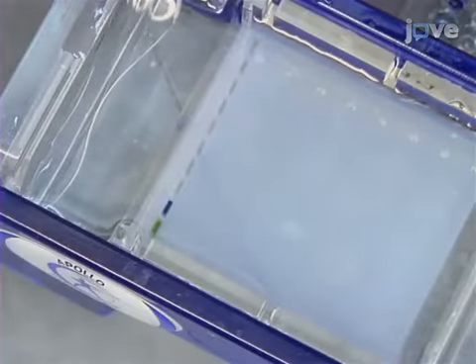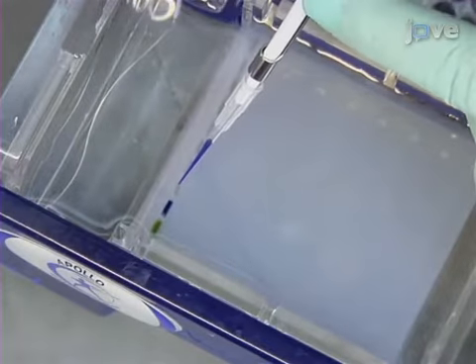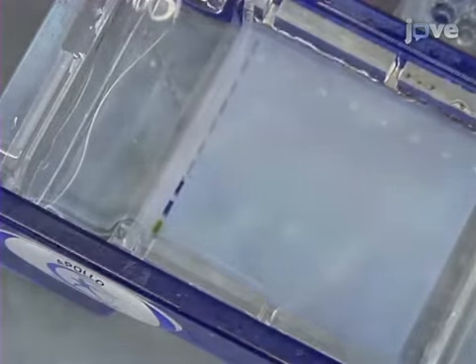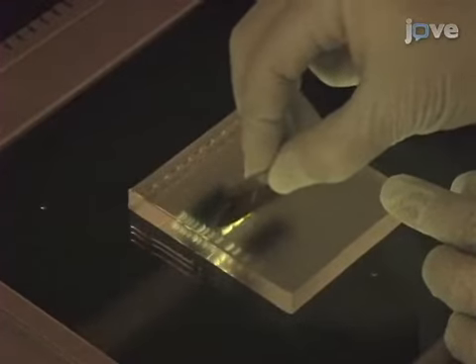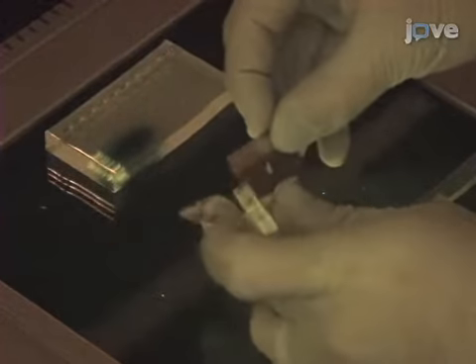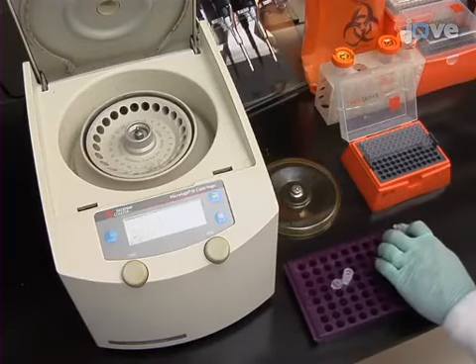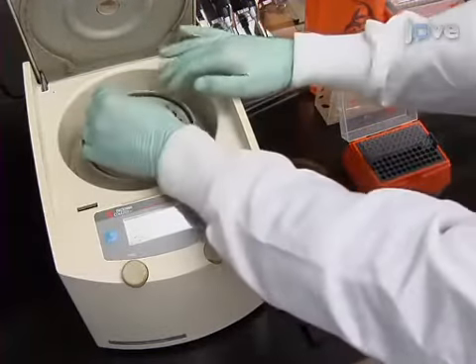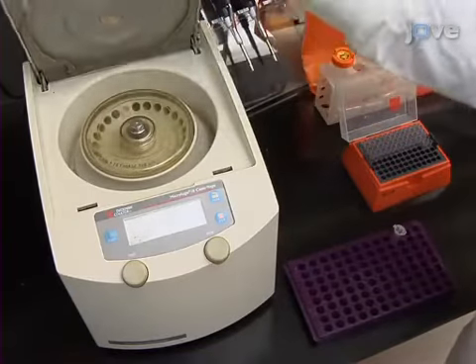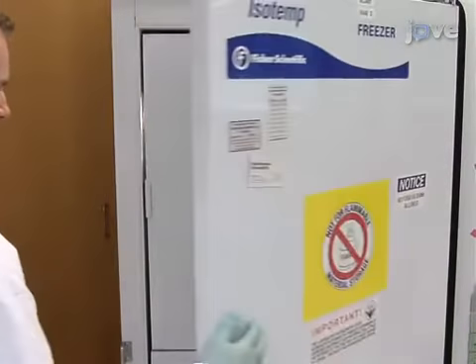After that, run the remaining 45 microliter reaction volume on a 1% agarose TAE gel containing the DNA stain. Excise the appropriate bands with a clean razor blade and combine 3 positive reactions per individual. Subsequently, extract DNA from the gel slice using a gel purification kit and elute it in nuclease-free water. Freeze the product at -20 degrees Celsius for use later.